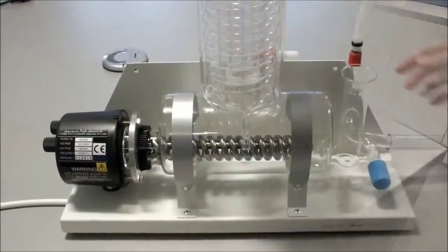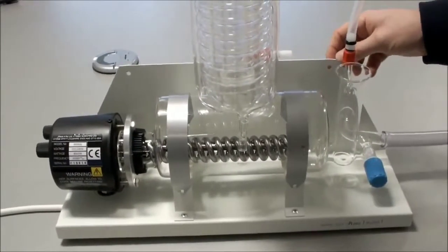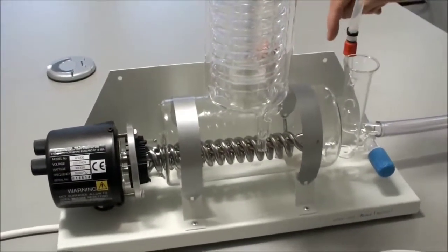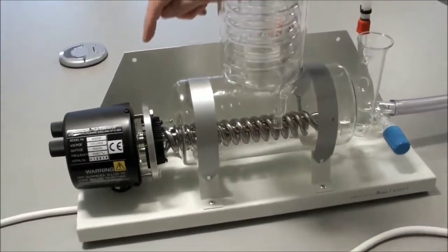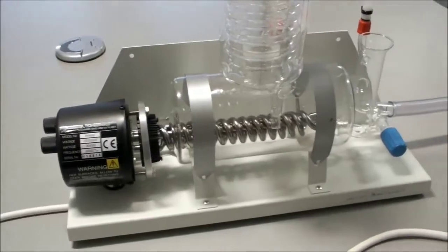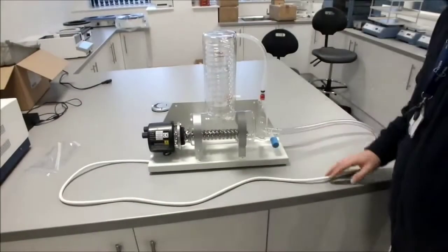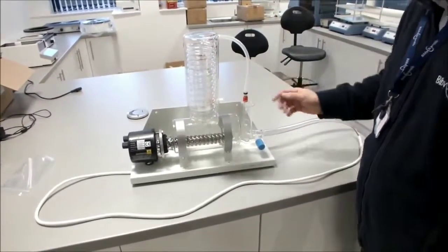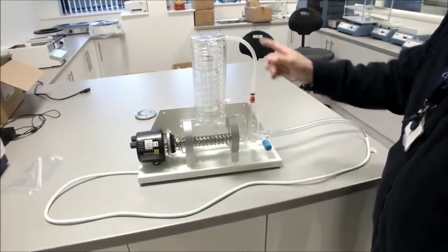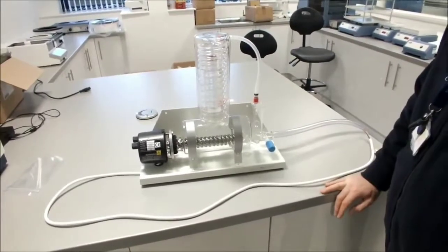Connected your drain, you can then choose the location of your water still. The water still can be wall mounted and there are two wall mounted holes provided. When we have our water still fully complete, connect your cold water supply, turn the cold water on, let the water run through and you can check for any leaks.